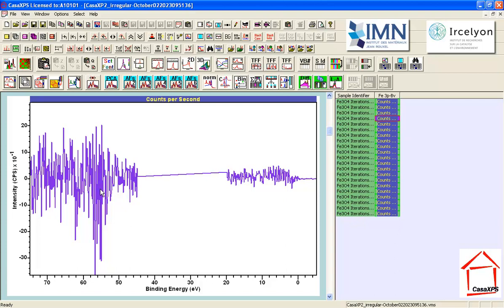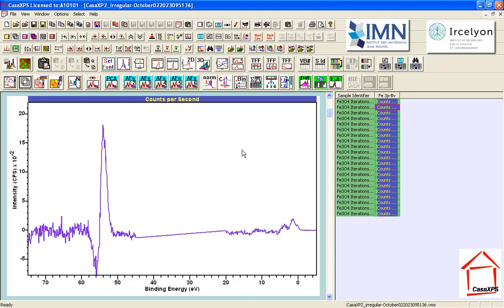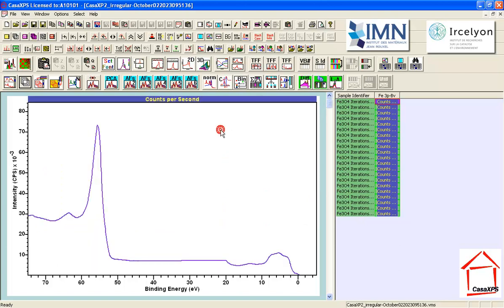That is to say, I'm assuming Poisson type behavior, so I would expect a random distribution around a mean, and depending on the intensity, we would see more noise, and less intensity, we see less noise. So this is consistent with three abstract factors indicating that we've got information, not a lot in this third one, more in the second one, but most of the signal is gathered into the first one. What I'm going to do now is try and find out what the difference is between the first and the last spectrum in this list.